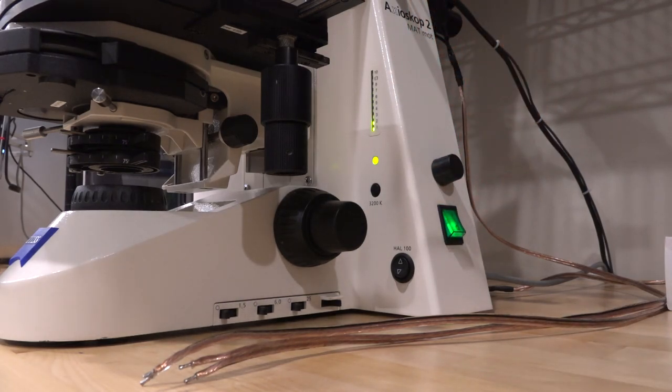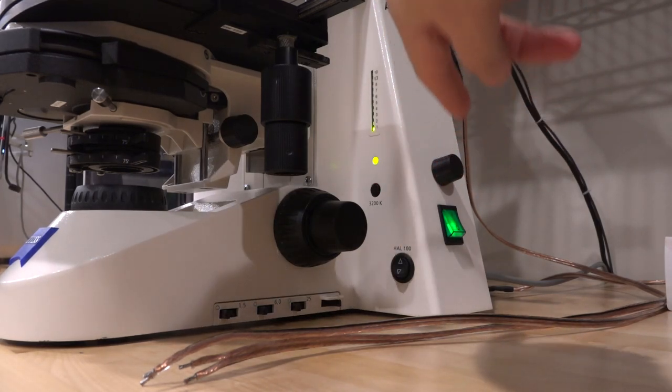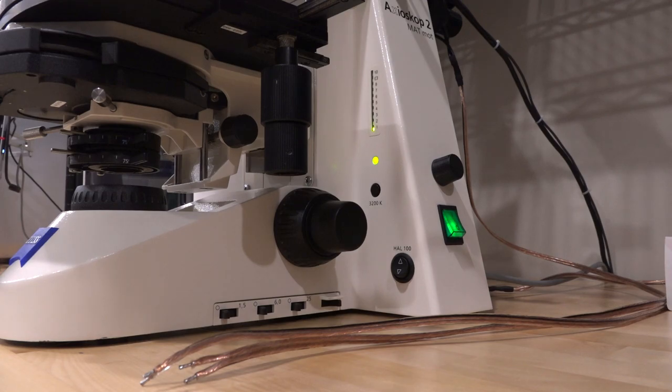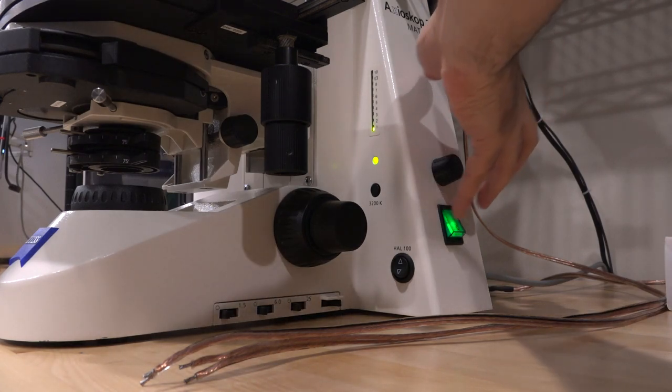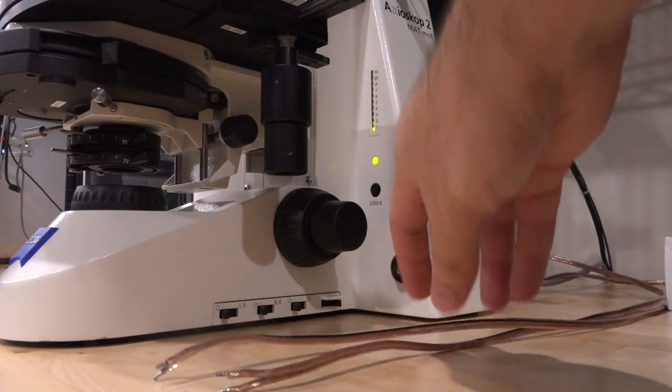which I want to maintain. Now, at the same time, I can't just connect those LEDs directly to the power supply here, because this power supply is controlled from 1 volt to about 13 or 12.5, and that's completely unsuitable for those LED lights, not to mention that they need a constant current driving, and the halogen lamp doesn't have any of those. So what I really want is to somehow translate the voltage coming from here into controlling a constant current power supply to control the brightness of the LEDs.